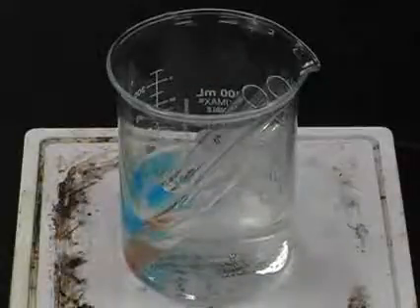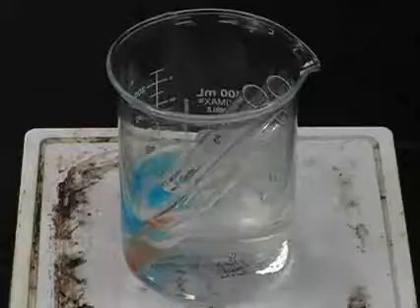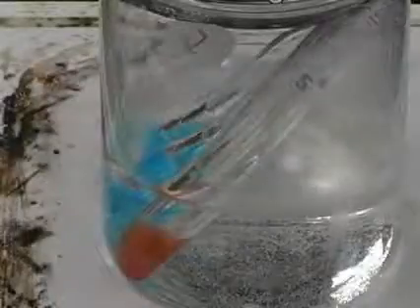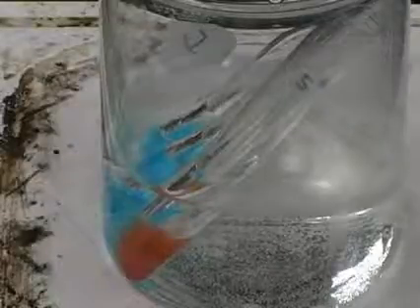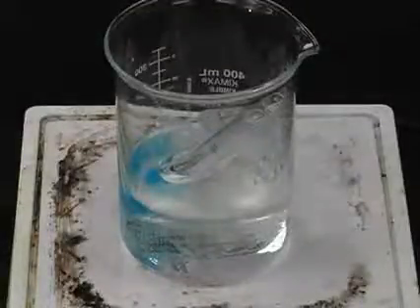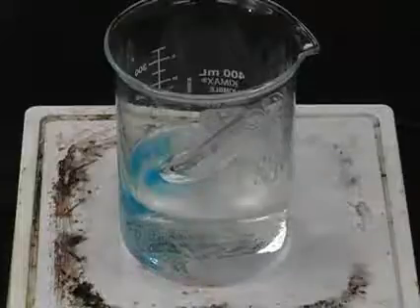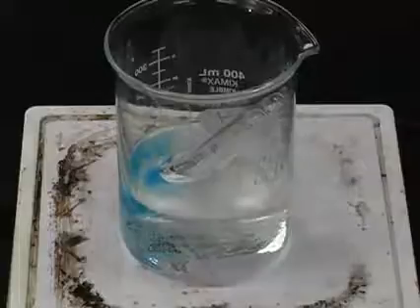After a few minutes, we may notice a yellow or orange-colored granular precipitate at the base of the test tube with the glucose solution. On the other hand, the tubes containing DI water and starch, a polysaccharide, show no yellow or orange precipitate. We can also perform the Benedict's test on an unknown solution. This is the final color we have. Can you tell if simple sugars are present in the unknown solution?